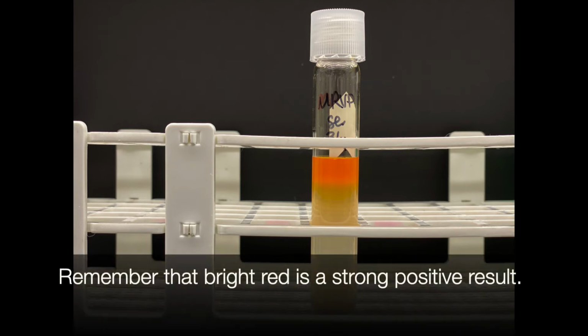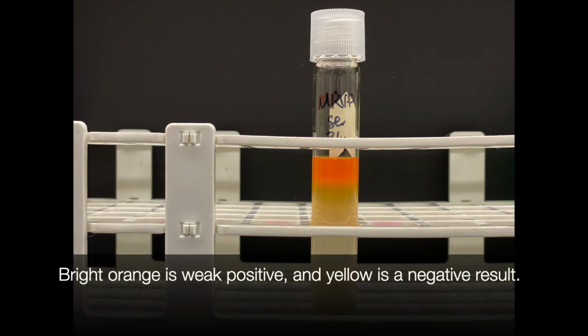Remember that the bright red is a strong positive result. A bright orange color is considered a weak positive, and a yellow is a negative result.